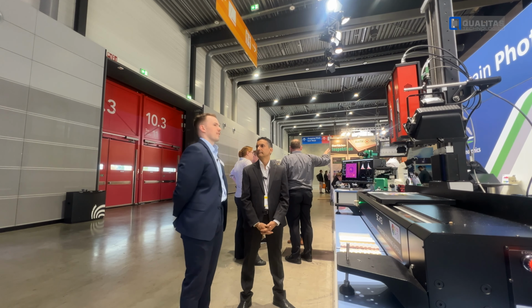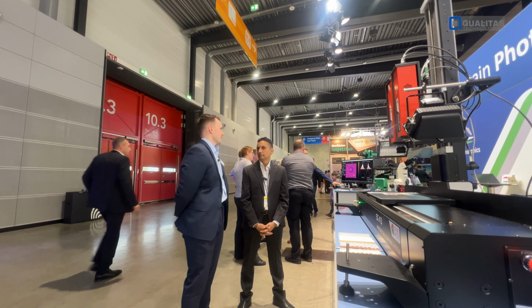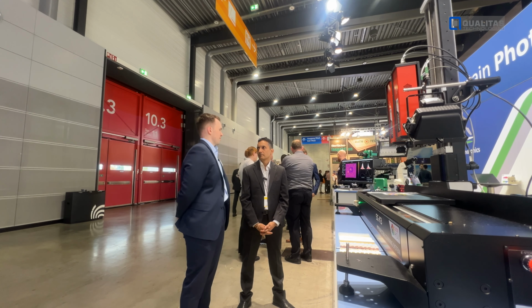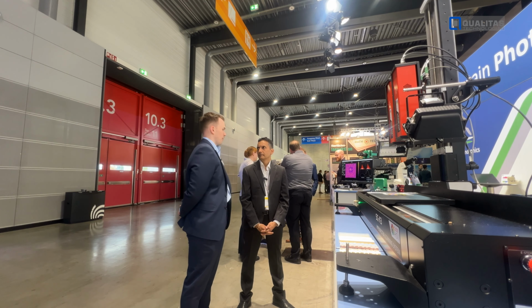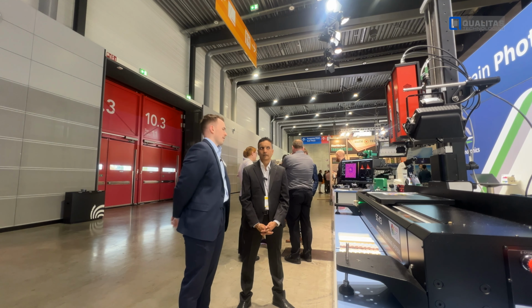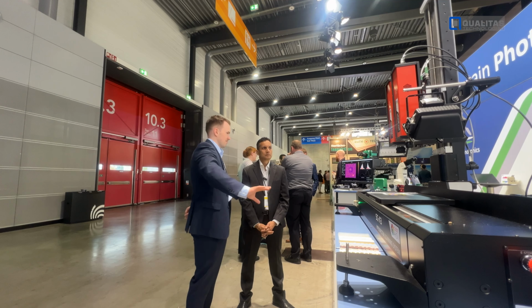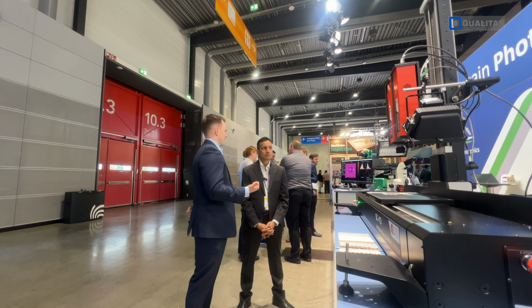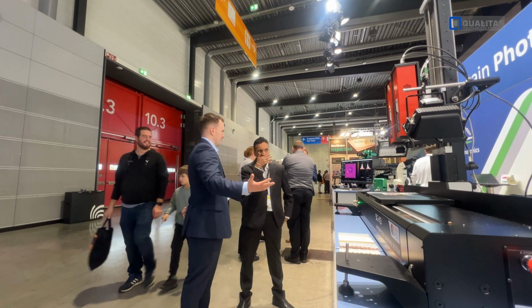So the visible camera has a spectral range of 400 to 1000 nanometers, and within that range, we get a data point every 2 nanometers. So in the visible spectrum, we get roughly 300 wavelength points at every single pixel. So we acquire photorealistic images of whatever we're measuring, any application. You get a visual representation of your sample, as you would with a standard RGB camera.